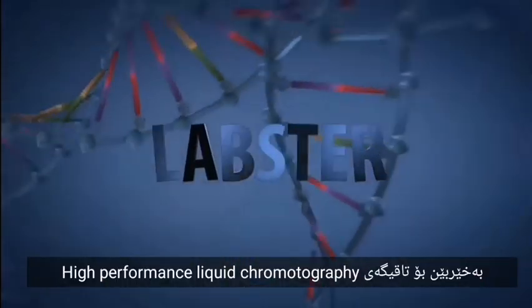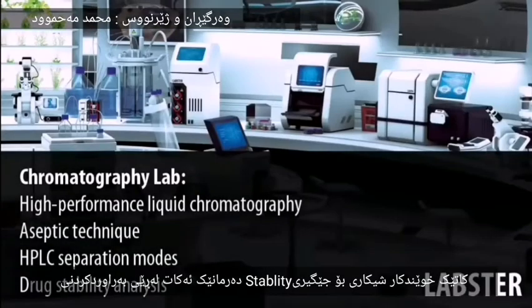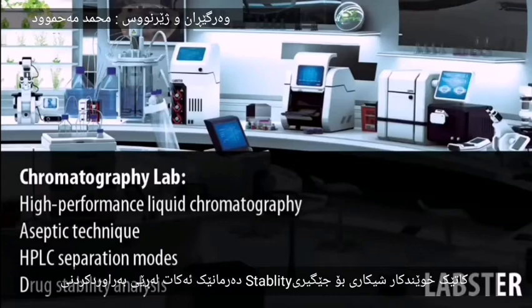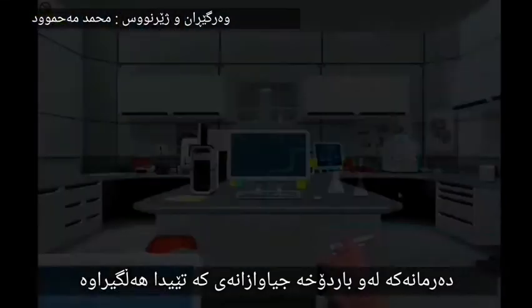Welcome to the Chromatography HPLC Lab, where students analyze drug stability by comparing drugs that have been stored in different conditions.